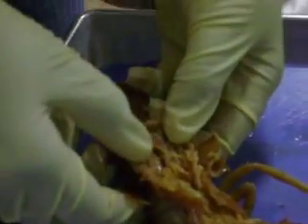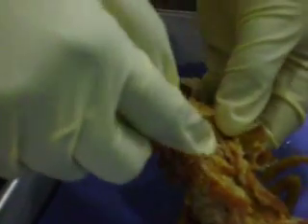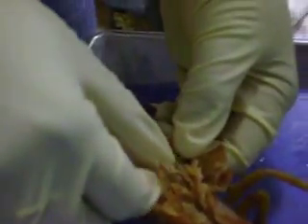We're having shrimp and I can't wait. What is more of a muscle? Terry, we found something different in ours — the intestine. Yeah, we found the intestine. So that is the intestine, and you had to pull mine out.